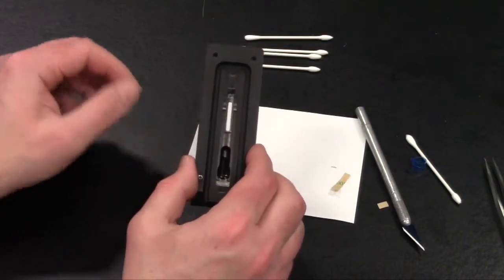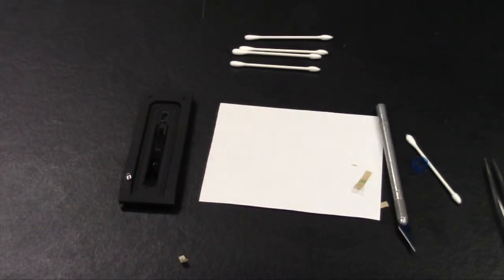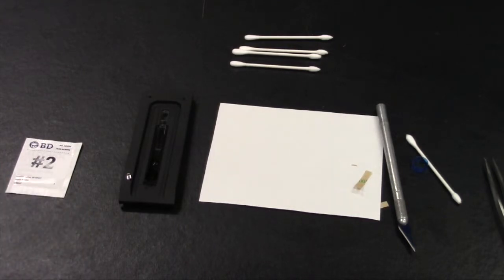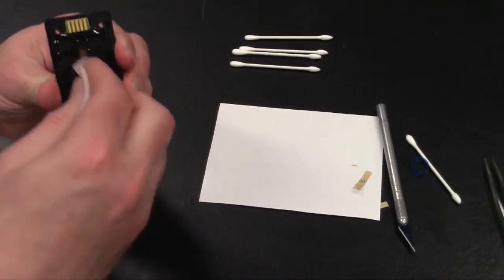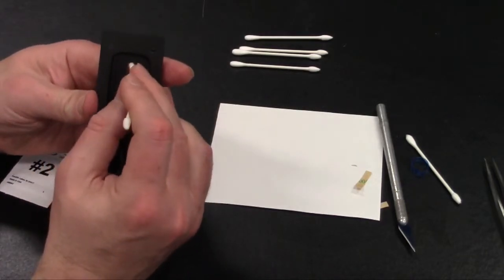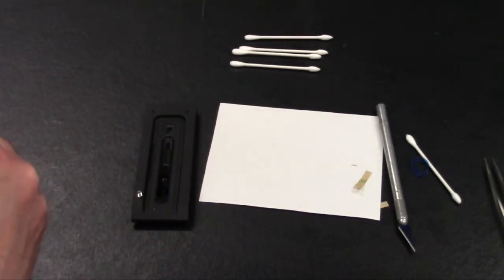So the last thing that we want to do is make sure that this whole lens is clean. So using the same supplied towelettes that came with the kit, we want to start by using again the soap towelette. Again, make sure everything's clean, whether you're using your fingers or you got some contamination on them by accident. So again, use the soap towelette. You can use the same swab and clean that internal lens area, making sure that it's clean. Remember to clean the top and the bottom very well. And you can use the swab to remove any contamination that you see there. And you can do the same thing with the alcohol wipe or the number 2 wipe as your final step.